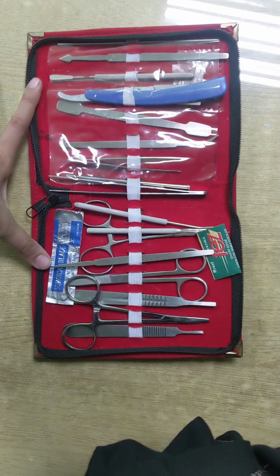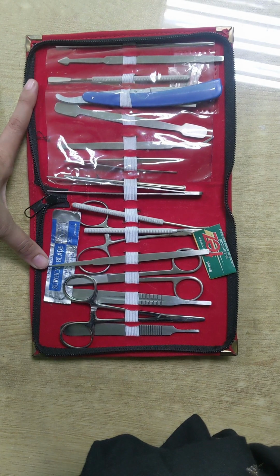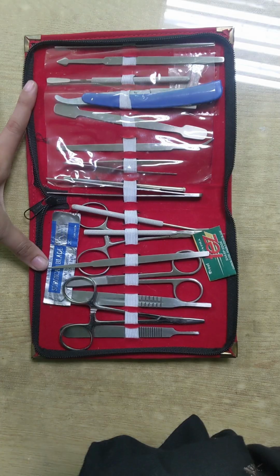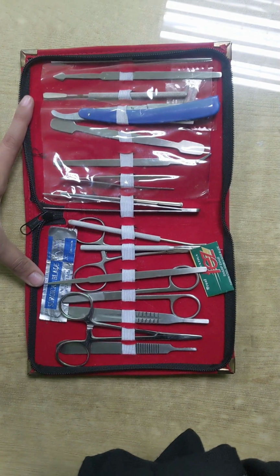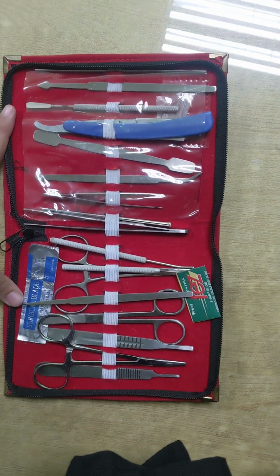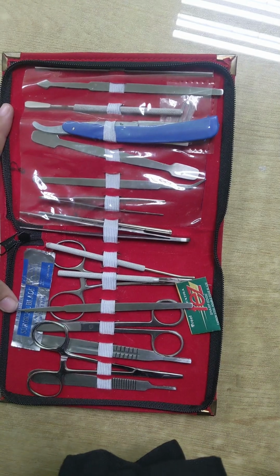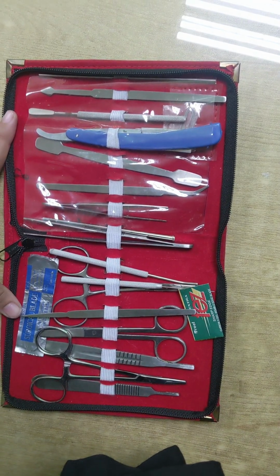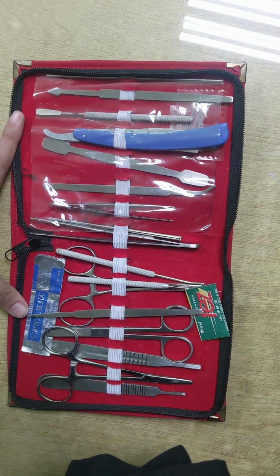So this is the whole story of the dissection kit. Whether you are performing an experiment or using a dissection kit, wear your lab coat and your gloves, handle every scissor and sharp instrument very carefully, and never ever point sharp instruments toward yourself or your fellows. Keep the work area clean, and after ending your experiment, dispose of the biological material properly, because safety should always be your first priority in laboratory experiments.